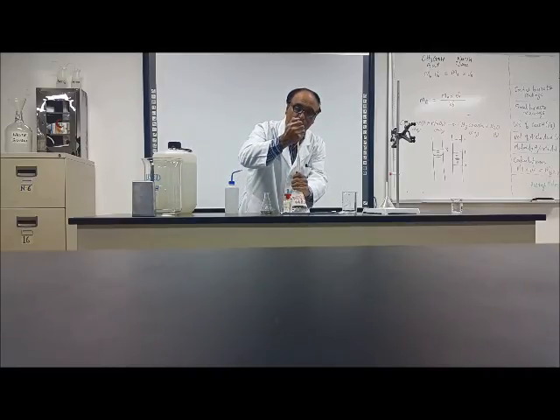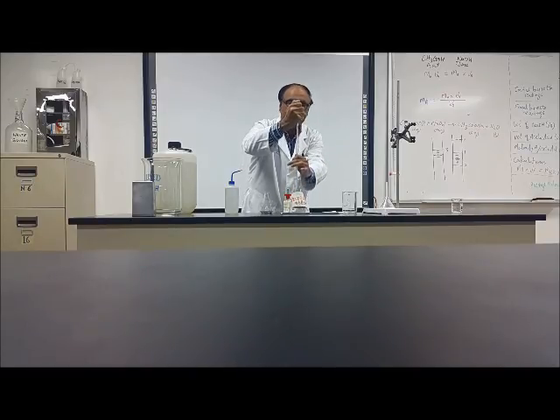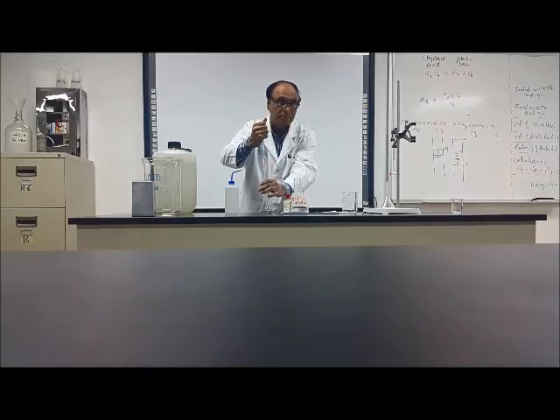There was 1 drop difference. We don't want a difference of even 1 drop, because it has to be very accurate. Like that. And now you put it here.